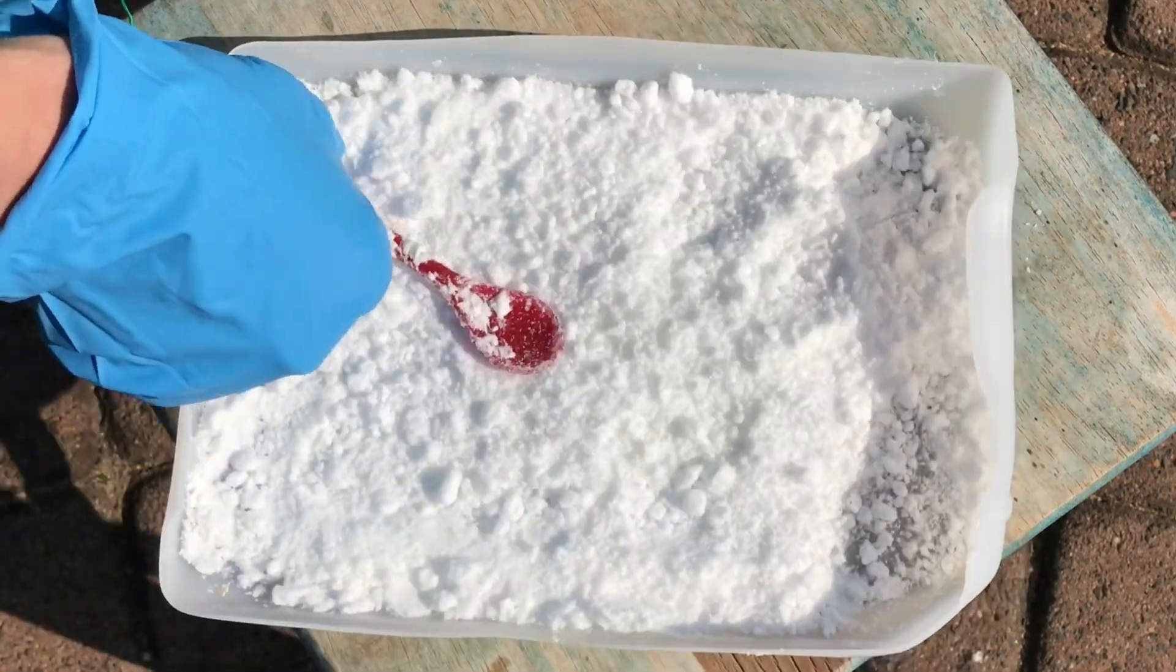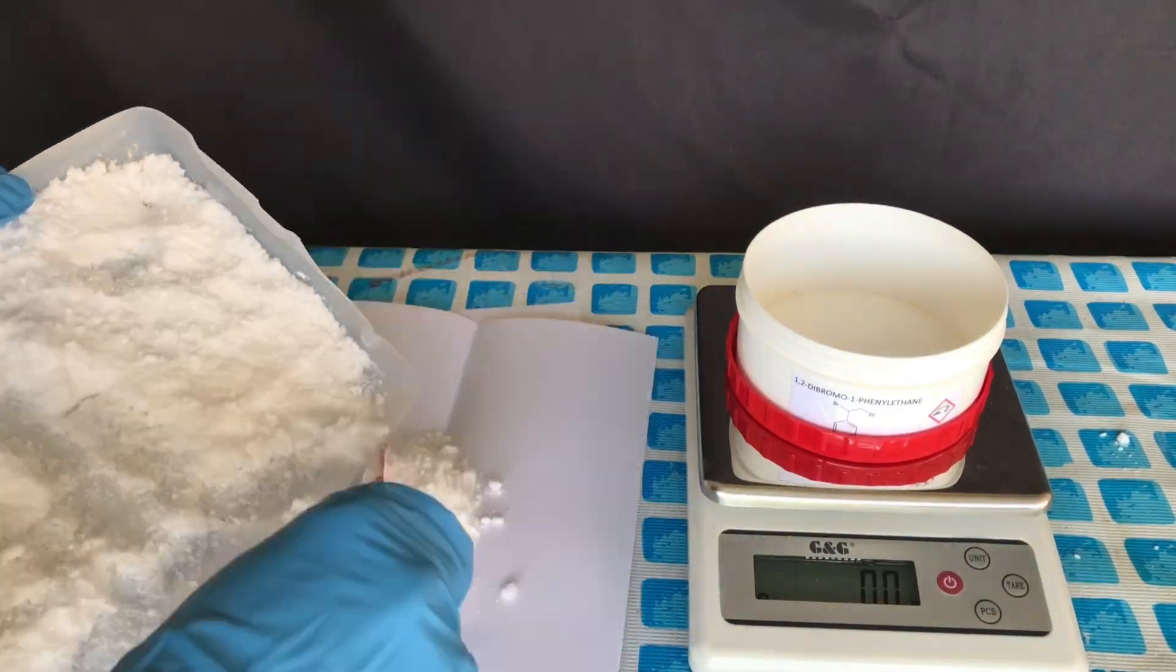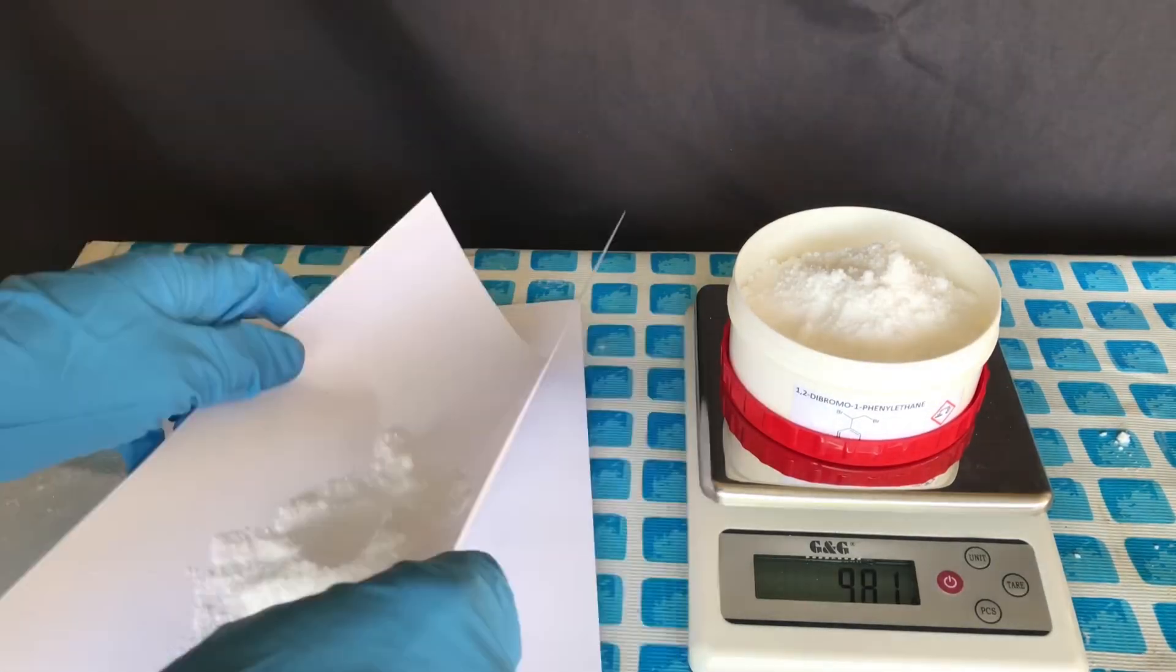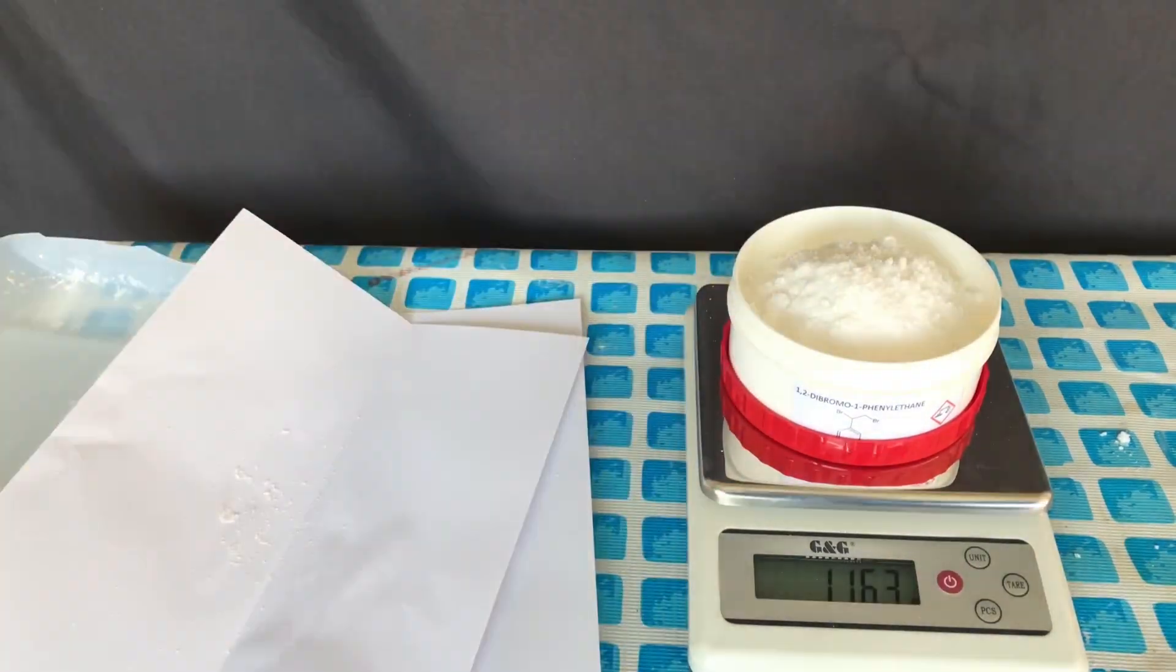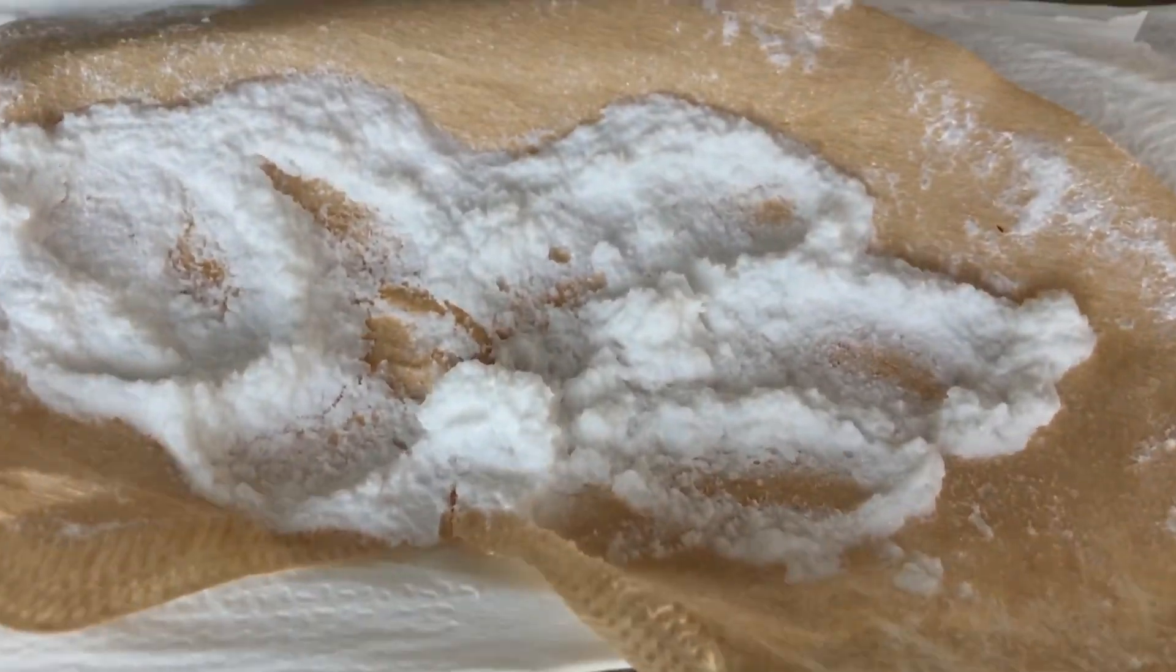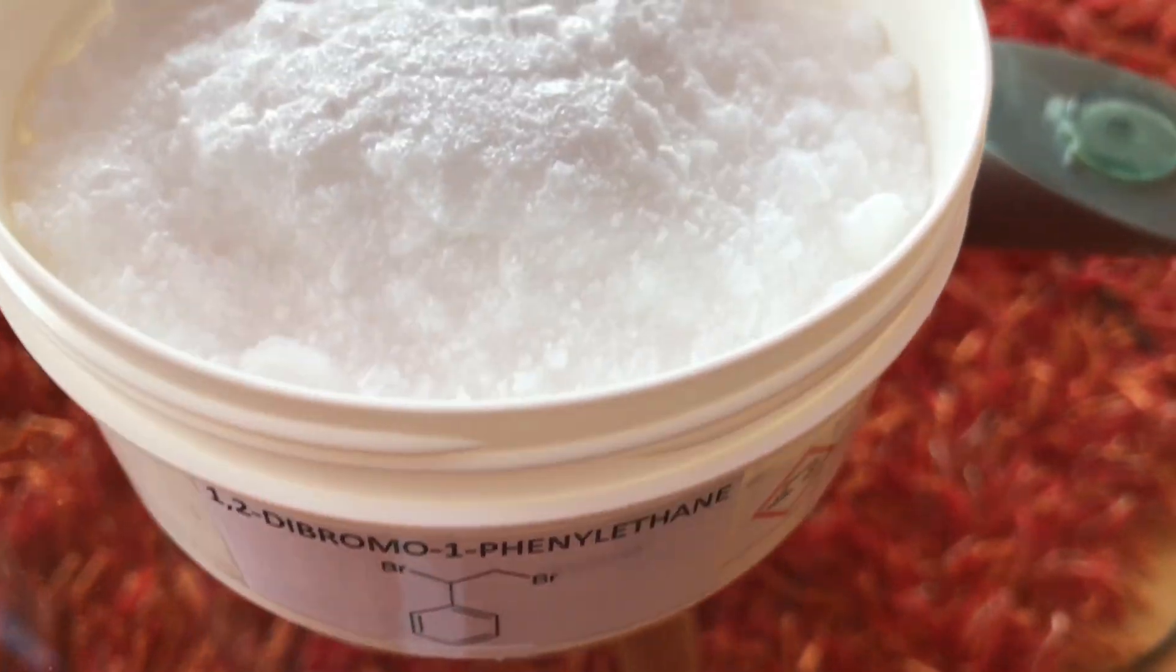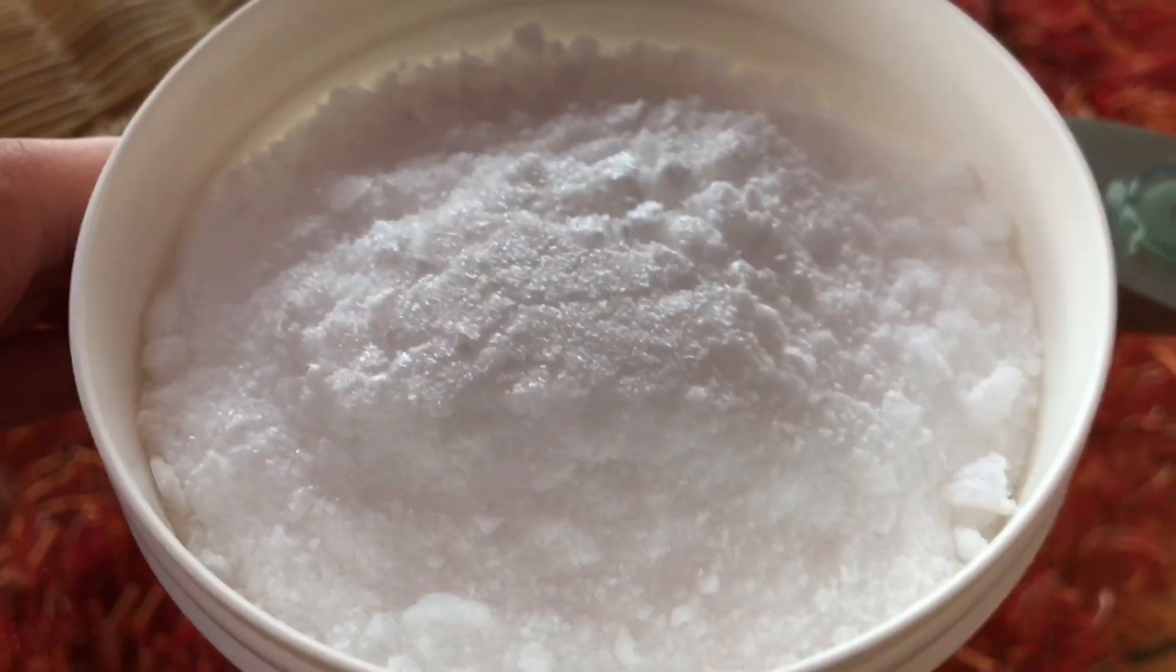After one hour of waiting the powder was bone dry. There's only one thing left to do, which is to transfer it to a container and to weigh it to determine the yield. We ended up with 116.3 grams, which corresponds to a yield of about 88.1%.